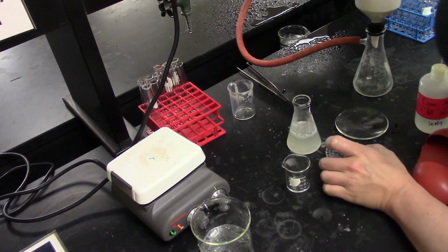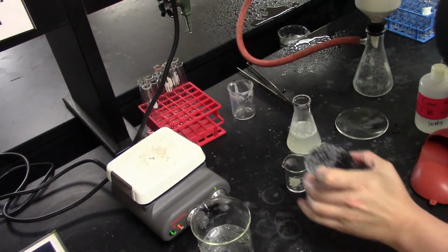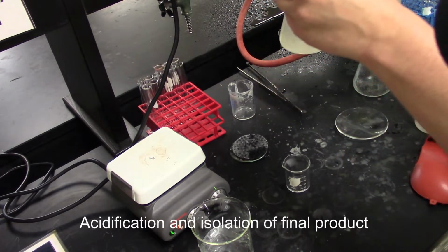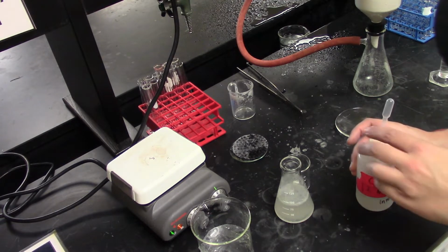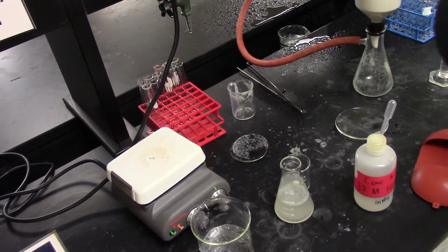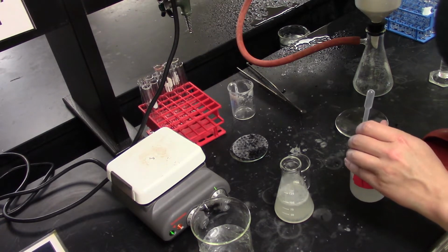So here's an example where we have our filtered material and there's just a lot of junk on this. So I took my filtrate from earlier, poured it into a flask, and I'm already starting to get a little bit of precipitation here. This might have been some of the liquefied or inorganic material that made its way through. But the next step here is we're going to acidify. And this is going to be pretty difficult to work with, but we're going to make it work.